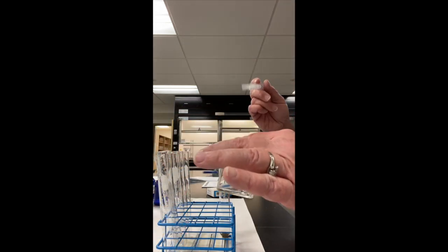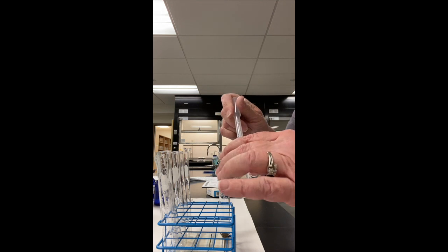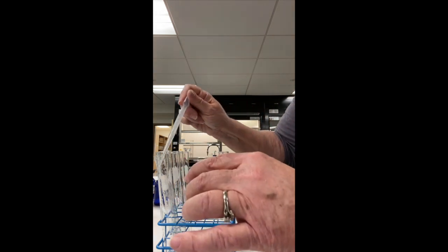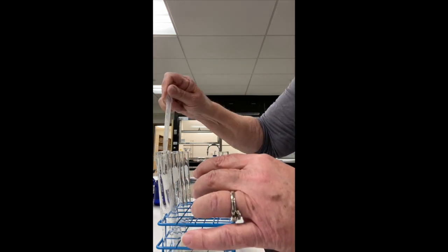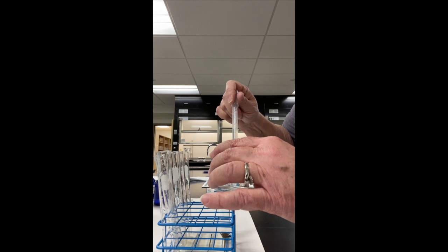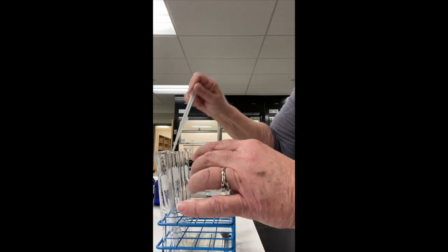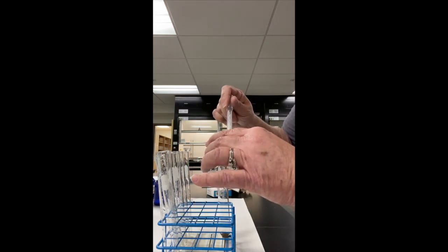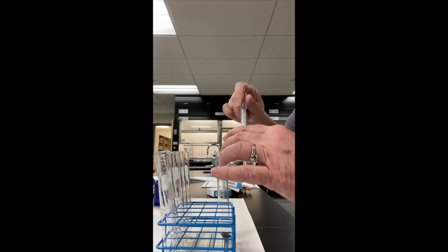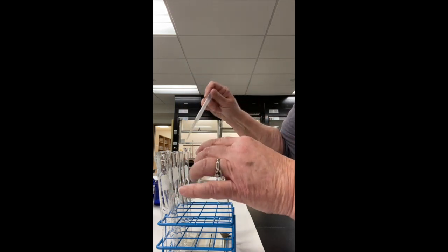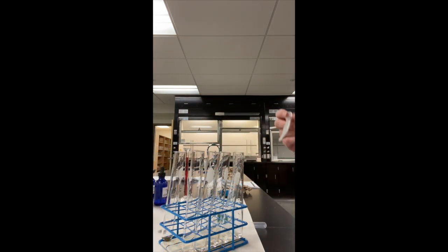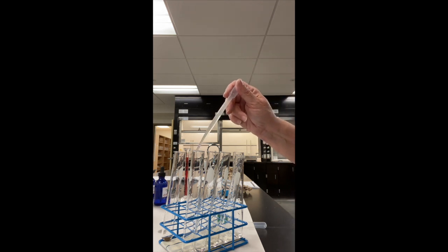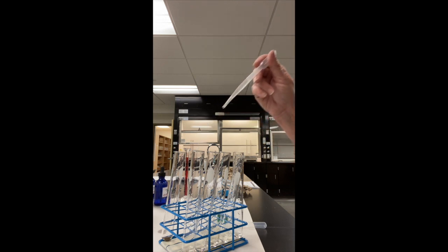Now I'm going to go ahead and it looks like I have almost 10 ml. So I'm going to put about a ml into each one of these. In fact, I'm using the transfer pipette I'm using actually has a milliliter mark on it. It makes it a little easier for me to go ahead and measure. And it looks like we did good. I'm going to go ahead and add a few more drops than the direction said. The direction say to add two to three, but I have notes for five, six, seven to add about seven drops.